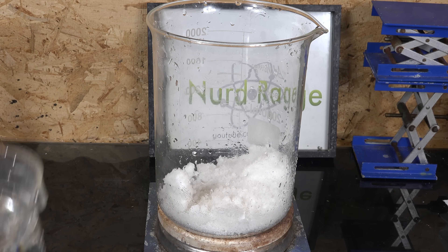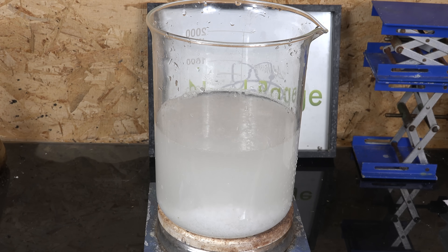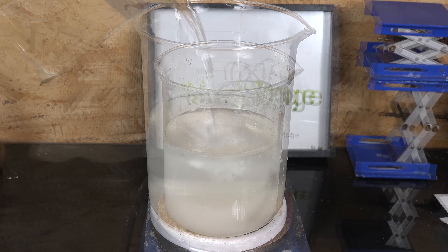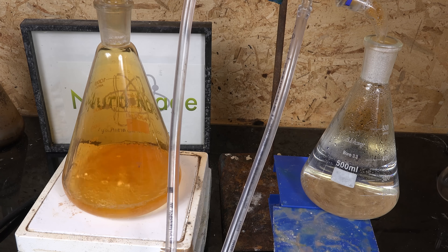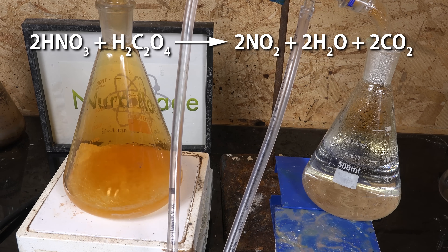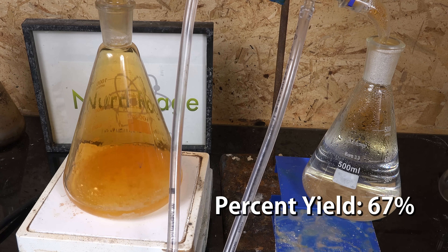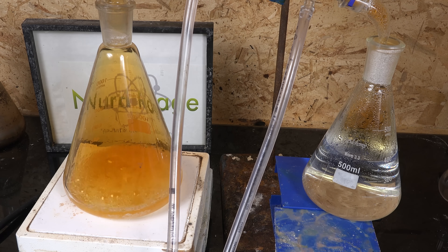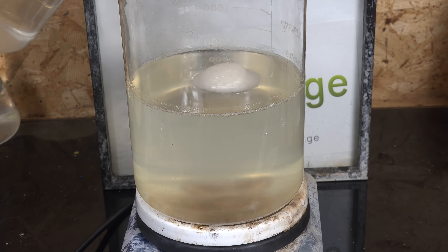Now some of you may be asking if using an excess of oxalic acid would give a better yield — maybe oxalic acid is the cheap reagent for you and calcium nitrate is the expensive one. So I gave it a try and mixed 300g of calcium ammonium nitrate along with 300g of oxalic acid. I went through the same process of boiling it down and distilling it, but I noticed the solution producing a lot of nitrogen dioxide gas as I distilled — a lot more than when calcium nitrate was used in excess. What was happening was the excess oxalic acid was reacting with the nitric acid at high temperatures and decomposing it. I found the yield to be 67%, and this is already after accounting for the ammonium nitrate. So the process is likely just as effective, but the decomposing oxalic acid reduces the yield slightly. The best results might be using exactly stoichiometric quantities of reagents or a slight excess of calcium nitrate to get the most nitric acid for the lowest cost.